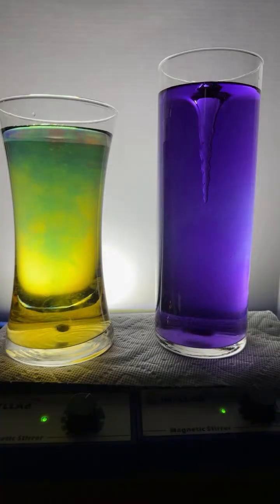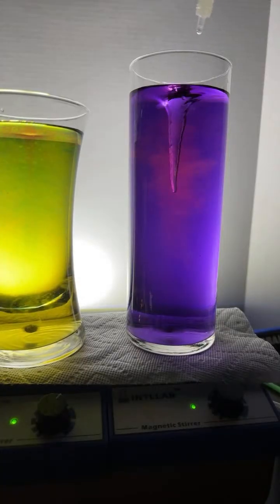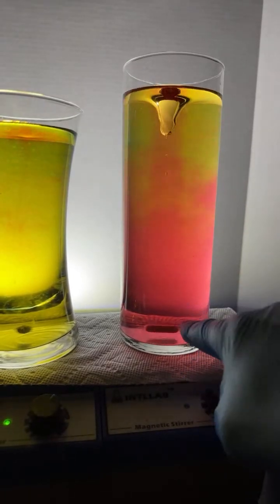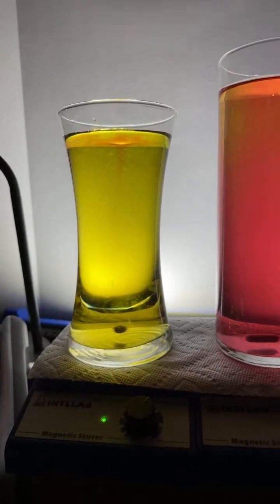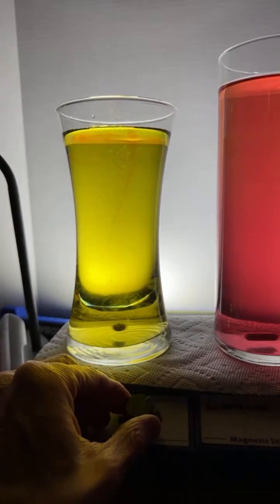Sorry there, angry British kid. How come the right one has a vortex thing? Great question. Okay, let's get it so we can see it a little better. So they're both on magnetic stir plates, but look at this. The one here, I'll stop the stirring. Look at how large this stir bar is compared to this one over here. This one's tiny. Here, I'm going to go ahead and try to turn this up. Maybe we can get, yeah, that's what I thought, Angelina.